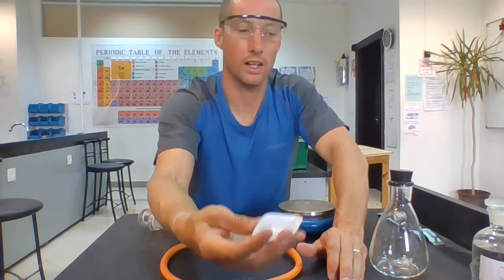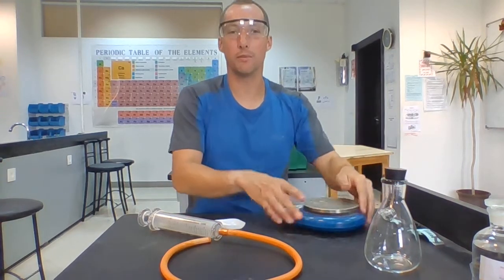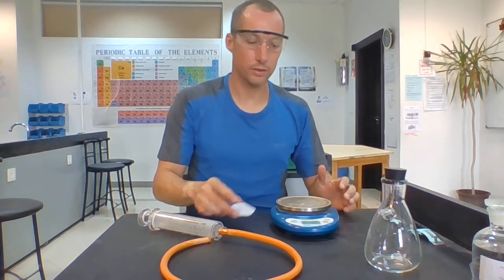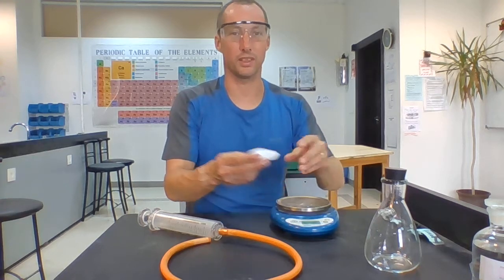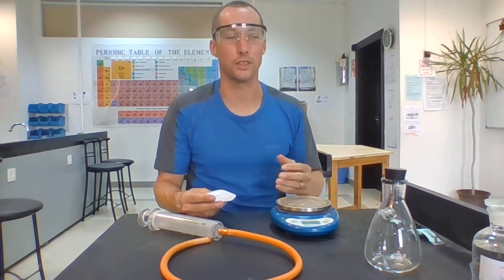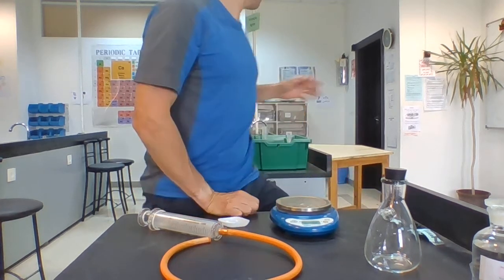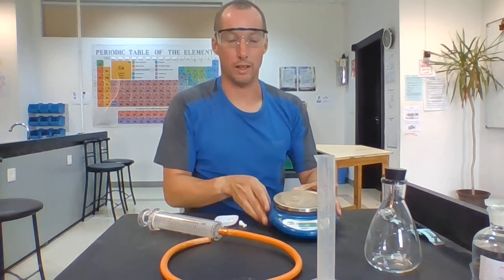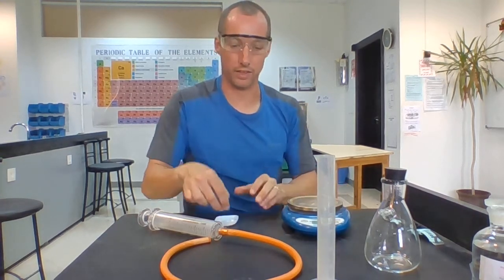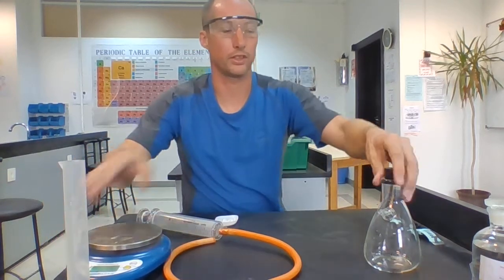Okay, so what I'm going to do first of all, normally we would try and make sure that we knew exactly what ingredients we were putting in. So I would measure out a set value of marble chips. Okay, at the moment I'm not too worried, I just want to show you the setup, but I should have a measuring cylinder available to measure out a set volume of acid, and I should have a balance to measure out a set mass of calcium carbonate. As I said, I'm not going to bother too much with that right now. Okay, I just want to show you the experiment.